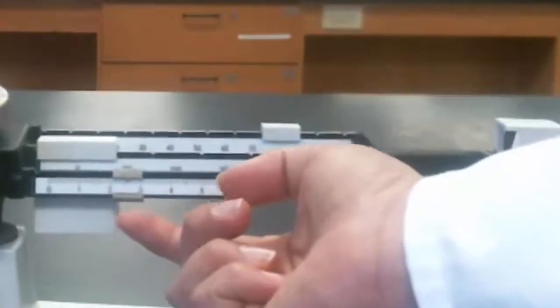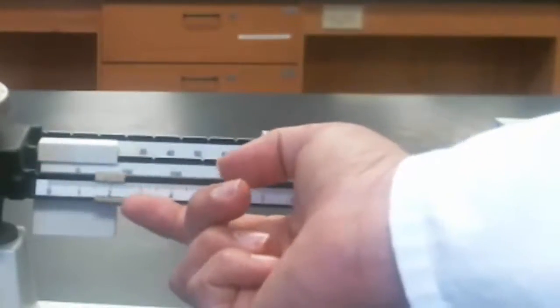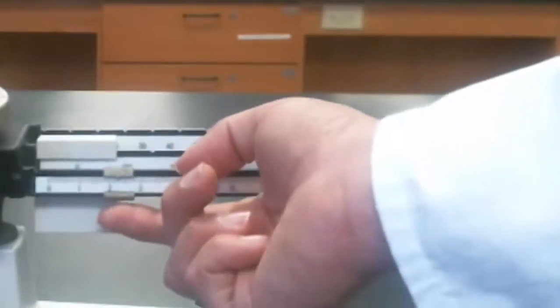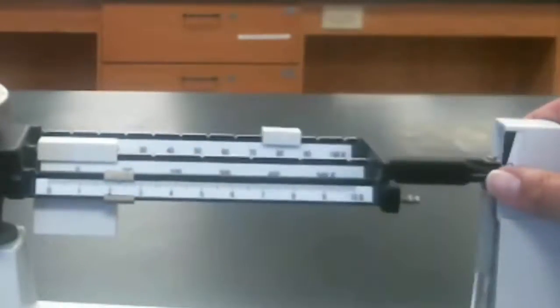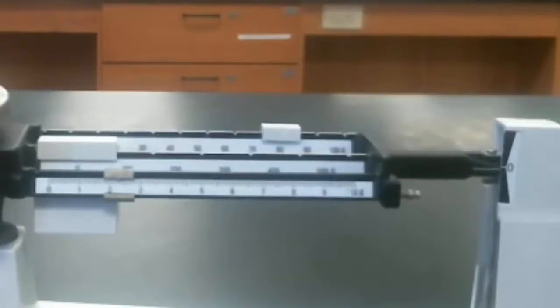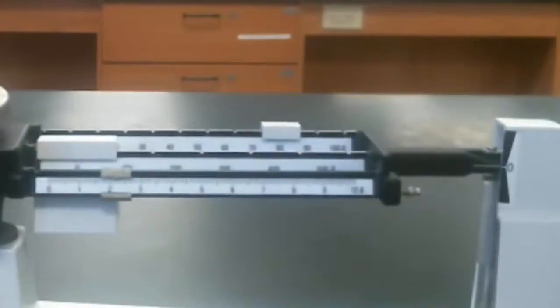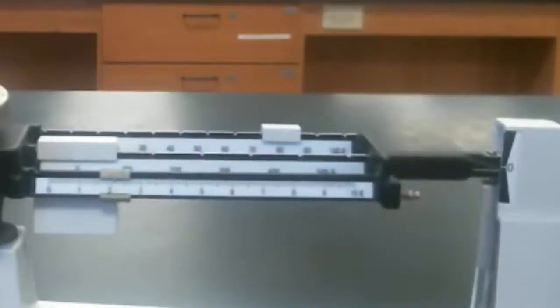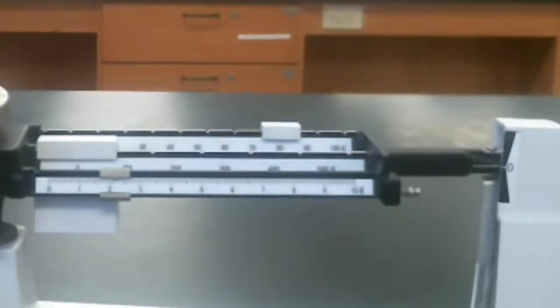It doesn't really matter right now where we move it. We just want to get these lines to match up, so we can just move it a little bit. Sometimes it helps to stop and see how we're doing. That looks close. We can flick this a little bit back if we need to, have it come up a little bit. Maybe just a little bit more. That looks pretty good.